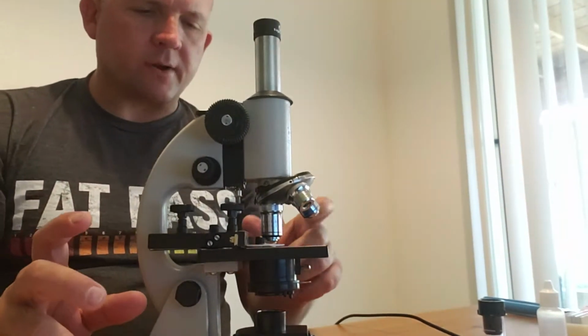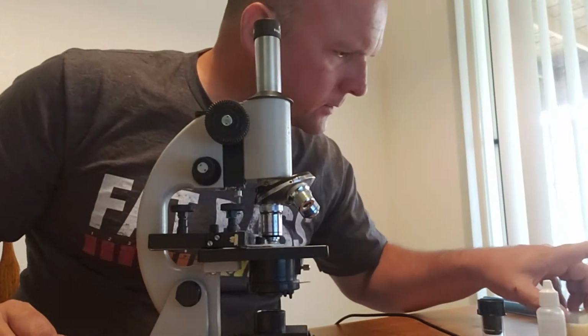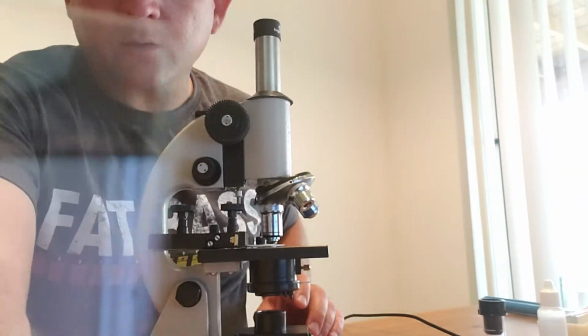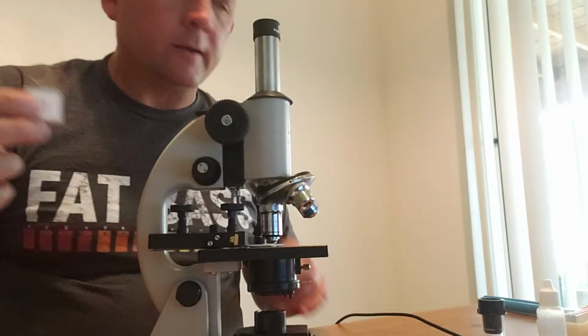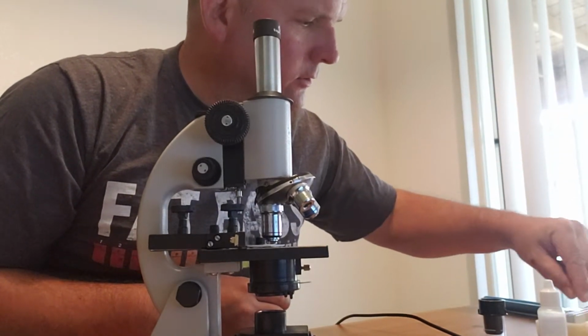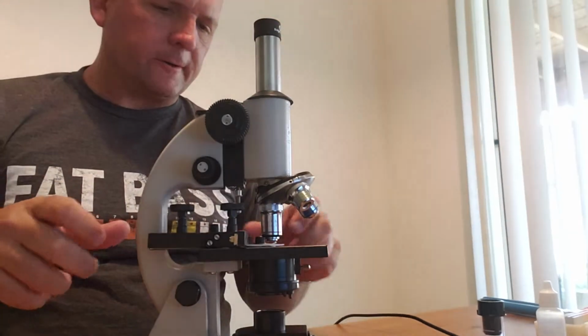And I started practicing that last night with the letter E slide, the letter E focus here. It's right there. There you go. You can see that E. Taking pictures wasn't too bad. I usually took pictures with my other classes, so I learned kind of how to focus my phone over it and be able to take the picture.